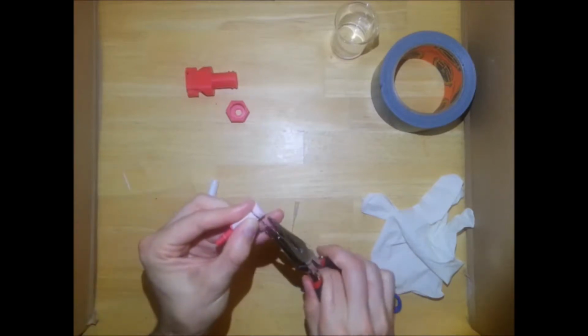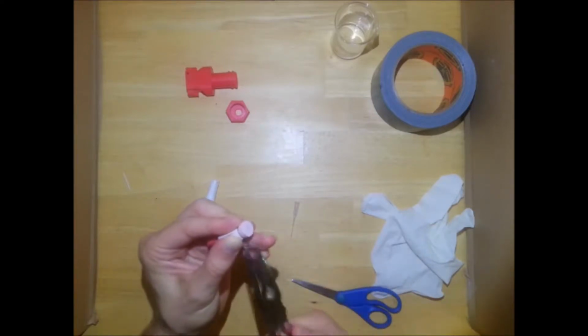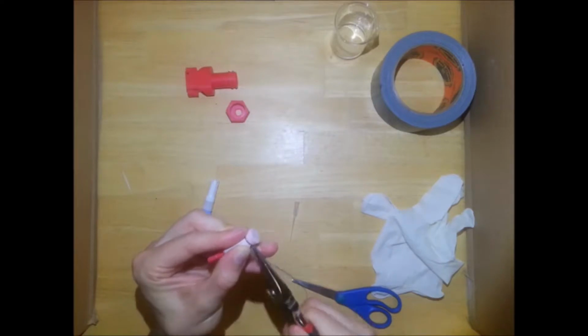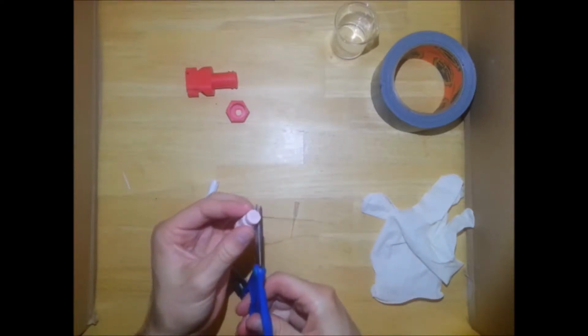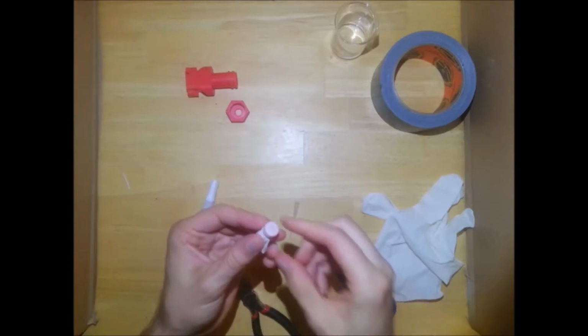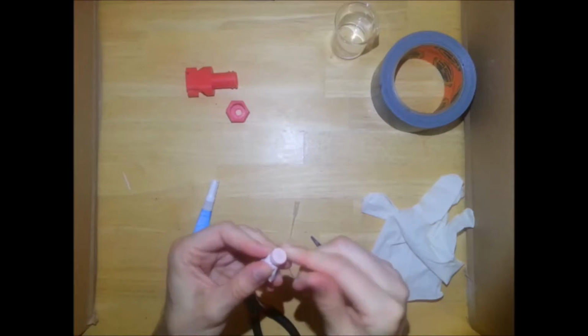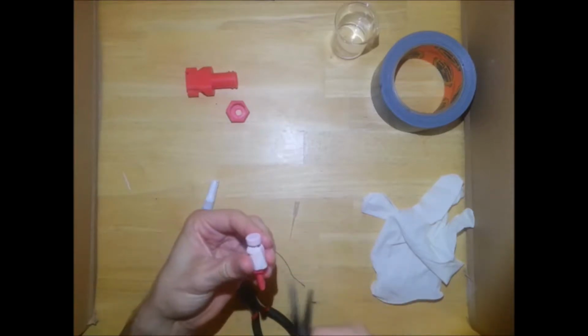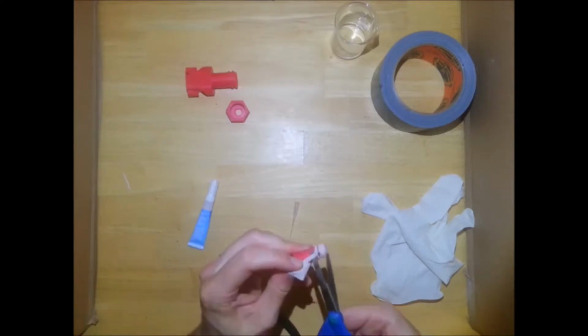And you want to twist it so that it's tight, tight enough to keep the rubber membrane on top nice and taut. And just clip that off. I'm going to make sure that none of the wire that you just clipped off is protruding out, and then you can just trim the rest of the glove.